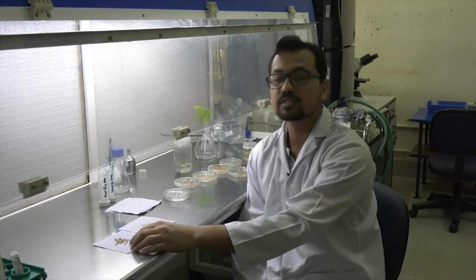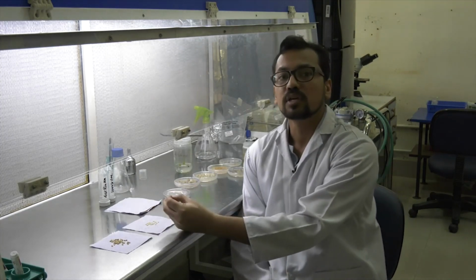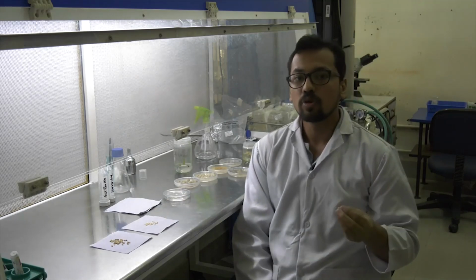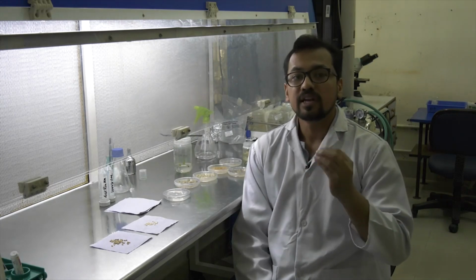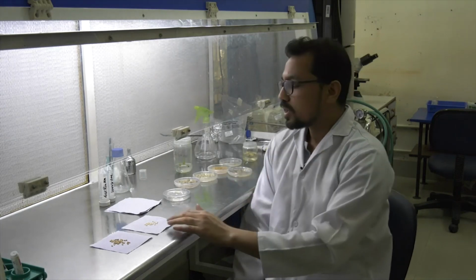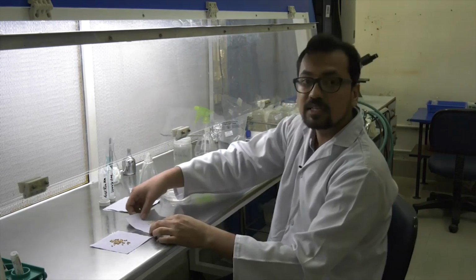Here you can see this is the dehusked rice, and here the embryo gives the callus under the influence of hormones. So when you give a certain hormone component, the embryo generates dedifferentiated callus, and this callus is further used for our further process. Now we'll see how we proceed. The first step is where we sterilize the seeds.